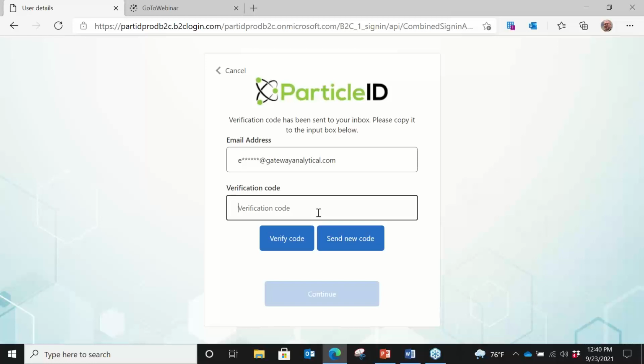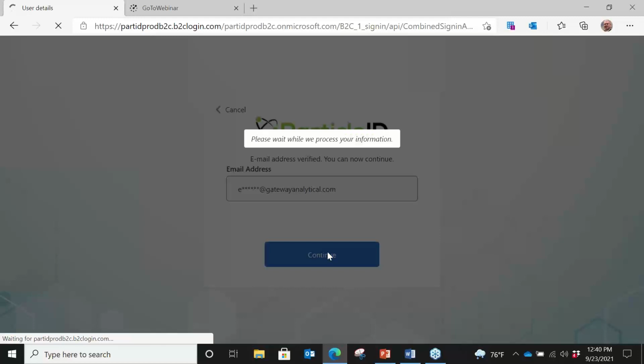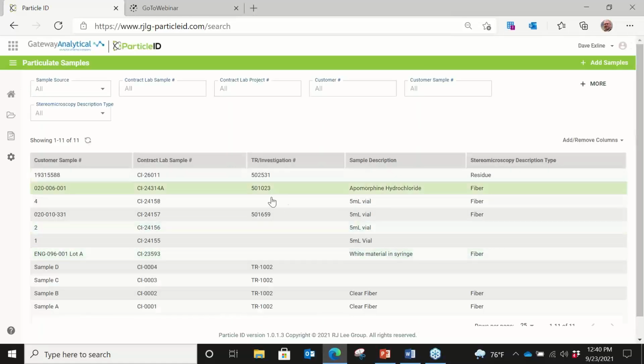And this is unplanned, so I apologize. This will only take a second to get back into the system. But again, as we talk about quality control versus just kind of putting things in a spreadsheet, this is something that's locked down and is a very secure database to be able to put data into. So that was not planned, but I'm glad it popped up. It shows on the quality side of things that there are these control functions in here.